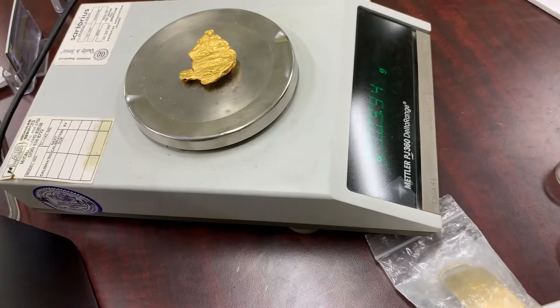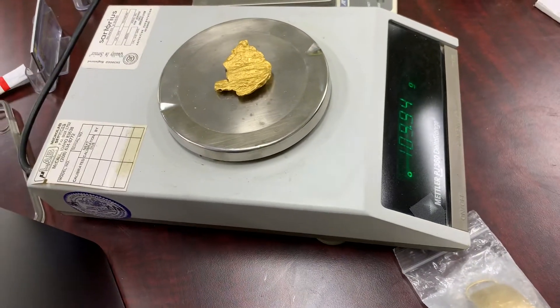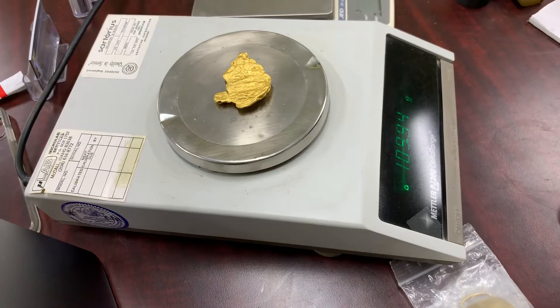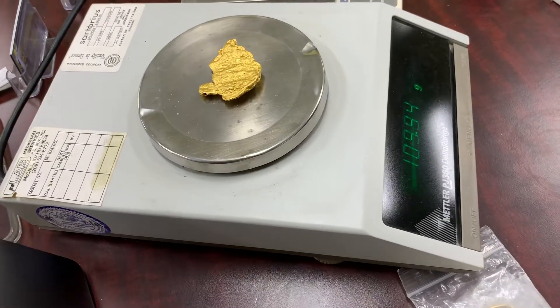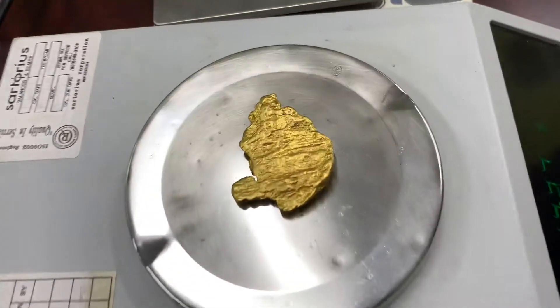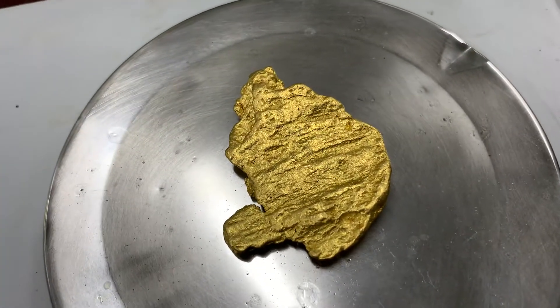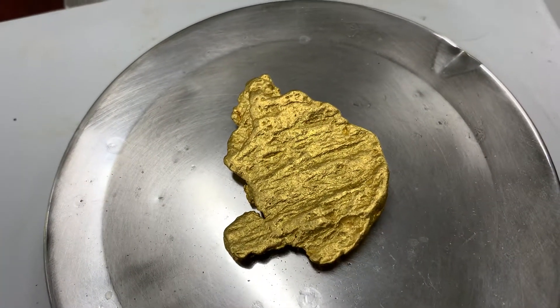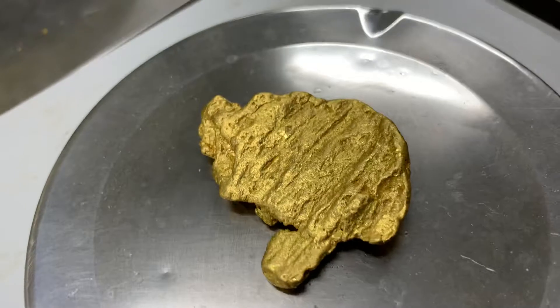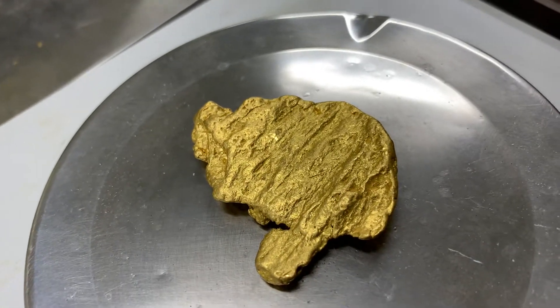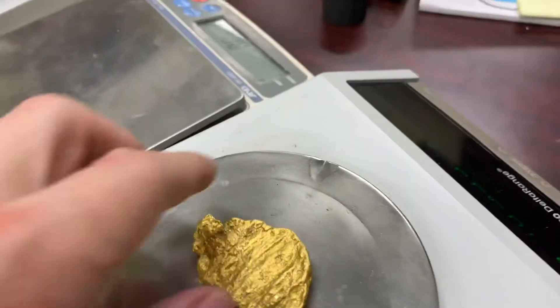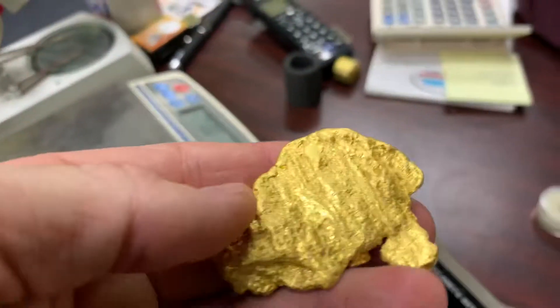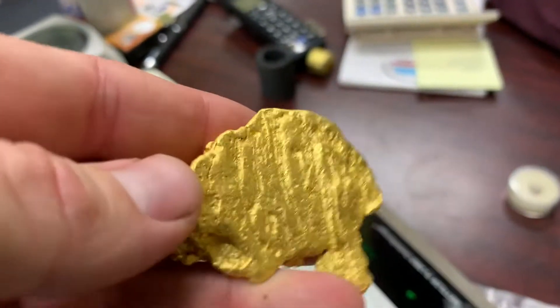9.4, so there's 3.452 ounce, 3.545, yeah 3.545. Looks like 3.53 or 3.54. And that thing just has, wow, you know, lines going all the way through it, the way the light hits it.